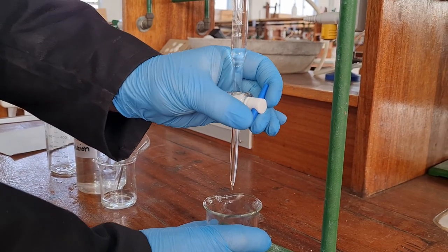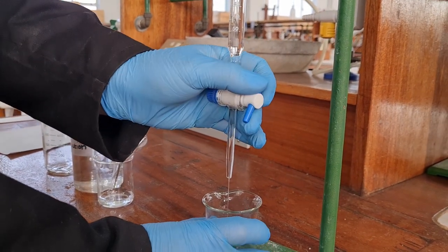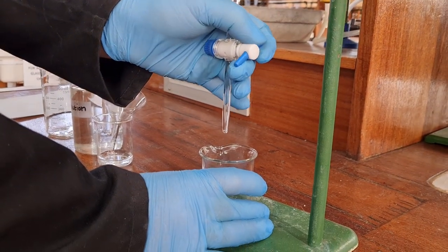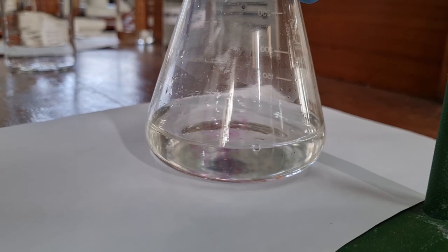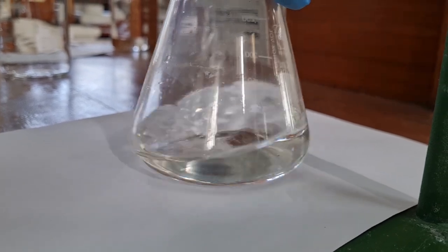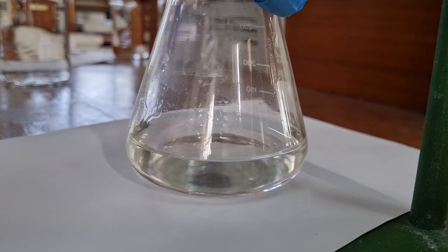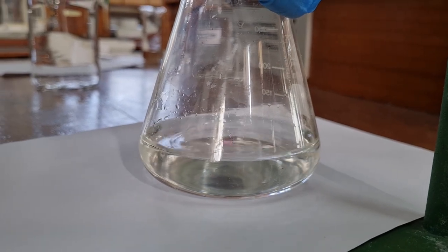If you are collecting a specific volume, use your left hand to control the tap while collecting solution with your right hand into a beaker. While performing a titration, collect the solution while swirling the flask with your right hand, ensuring that the reactants mix immediately.